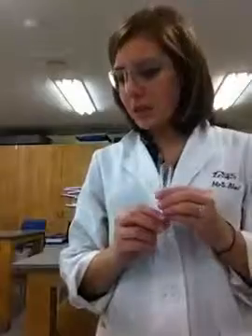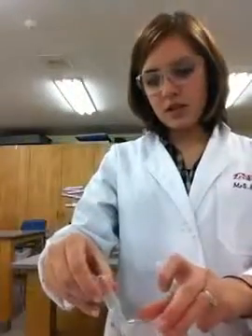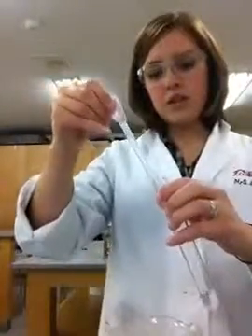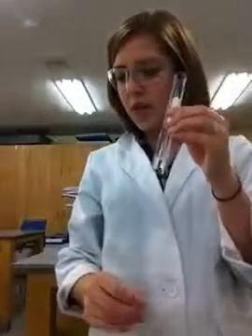Okay, this is Mrs. Black again, and we're going to be testing now for anions, negative anions. So we'll begin with the chloride ion in potassium chloride, KCl. We'll first start with 3 milliliters of this. So there we have our 3 milliliters of our chloride ion. And to test for this, we add a few drops of nitric acid.